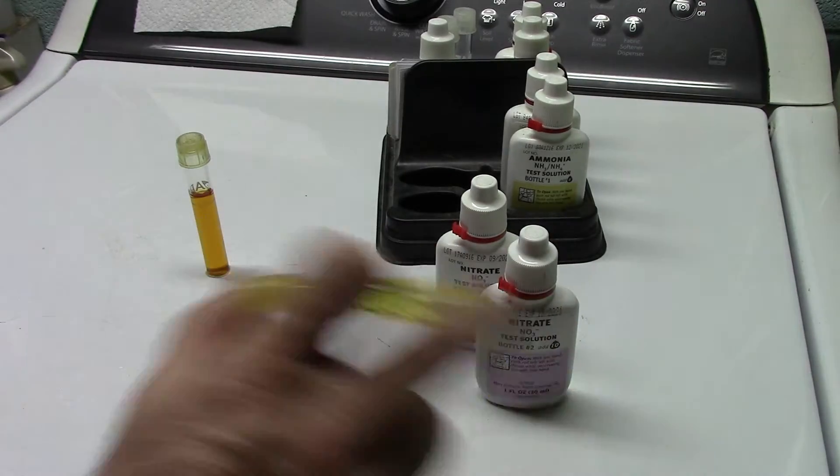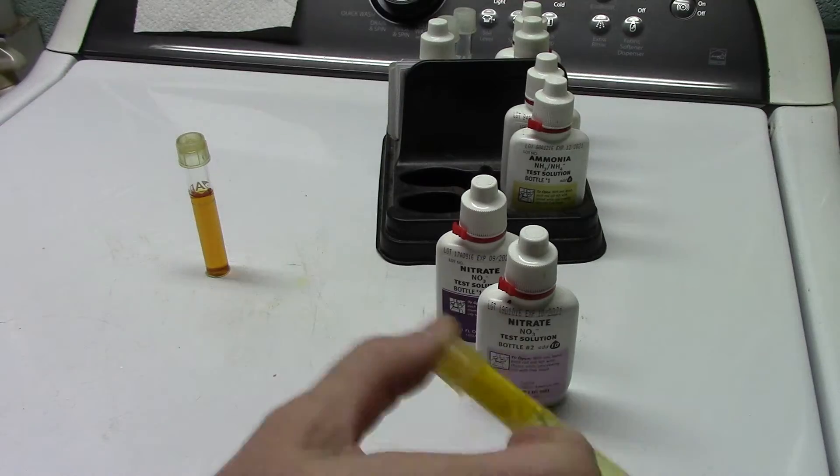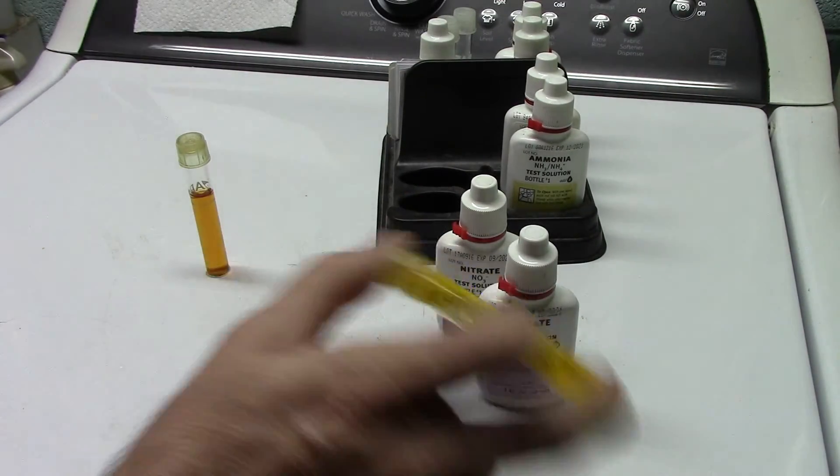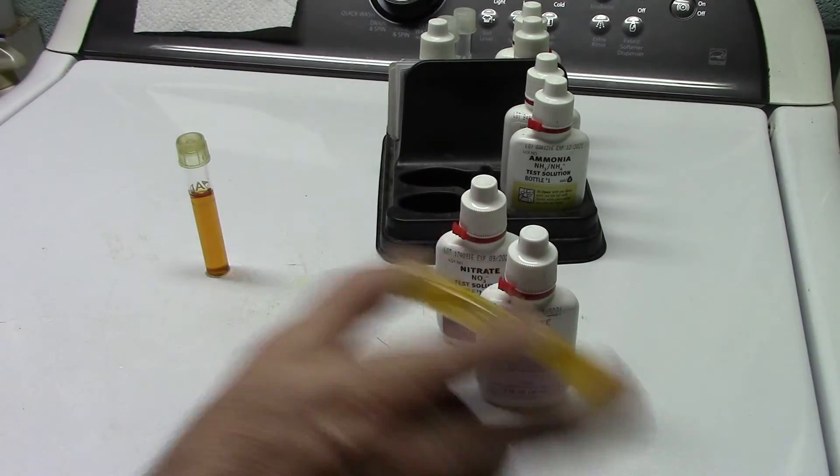Is I did this the other day and I knew on the second part of the test you were supposed to shake vigorously according to the instructions, and you were supposed to do it for a certain amount of time. And I thought you were supposed to do it for about 30 seconds, and I said you only had to do it for about 15 or 20.